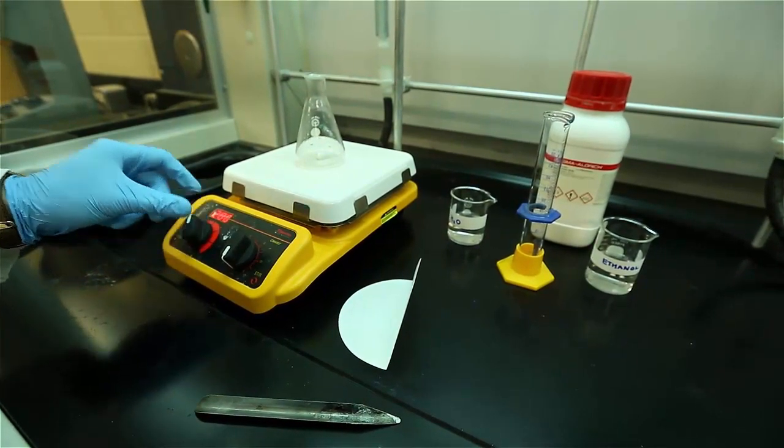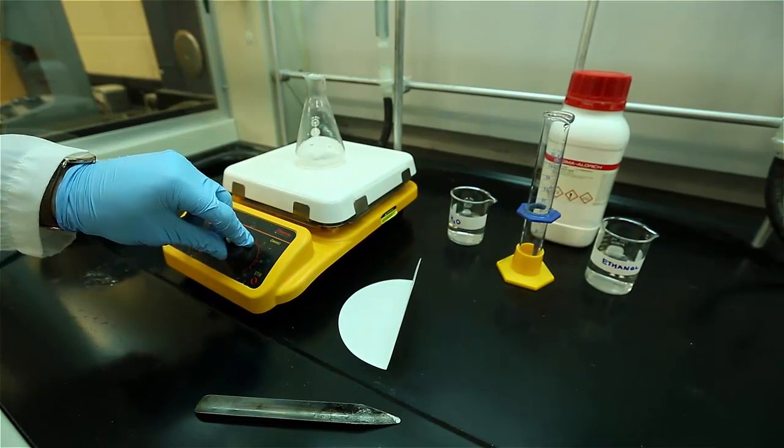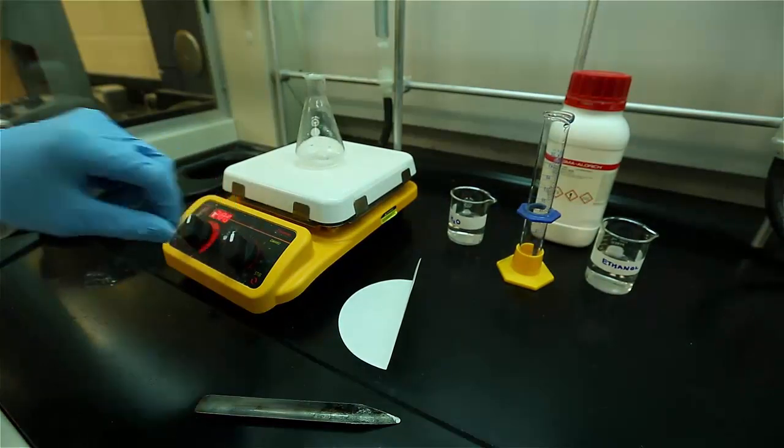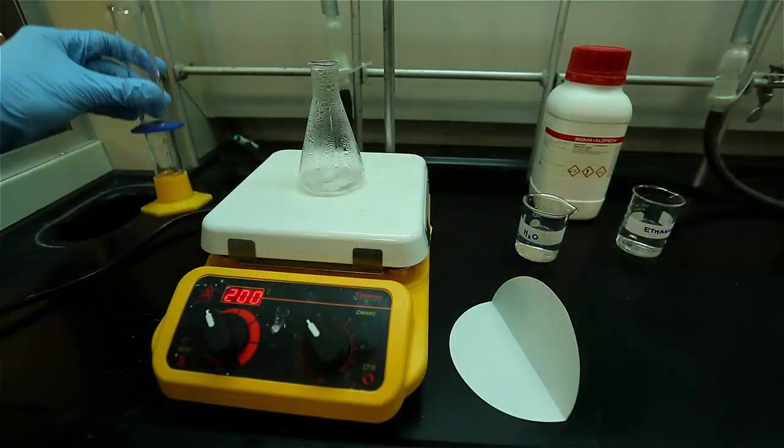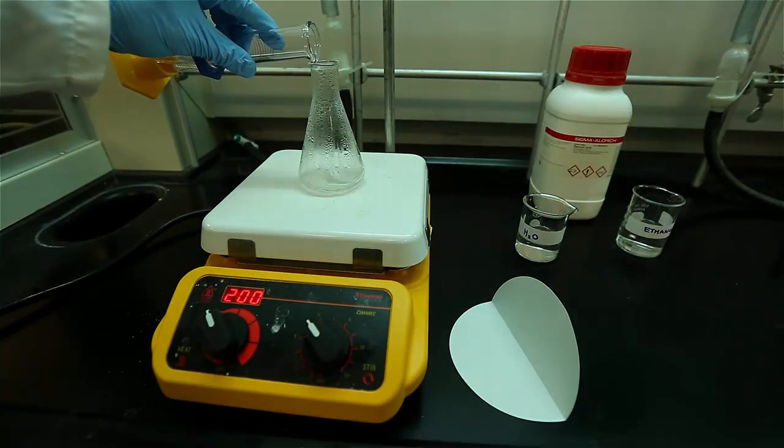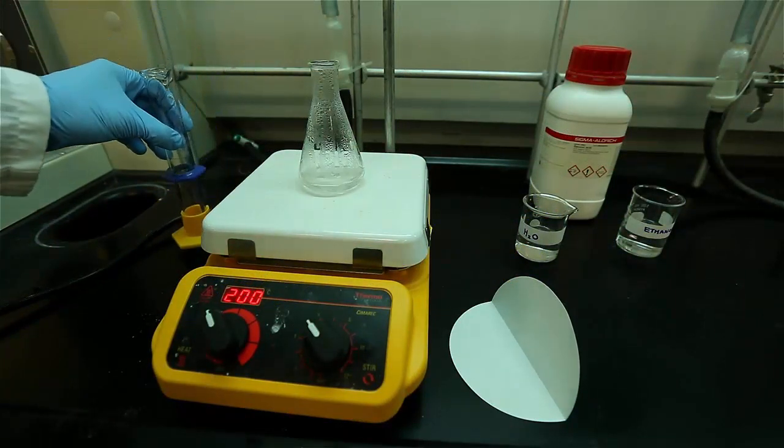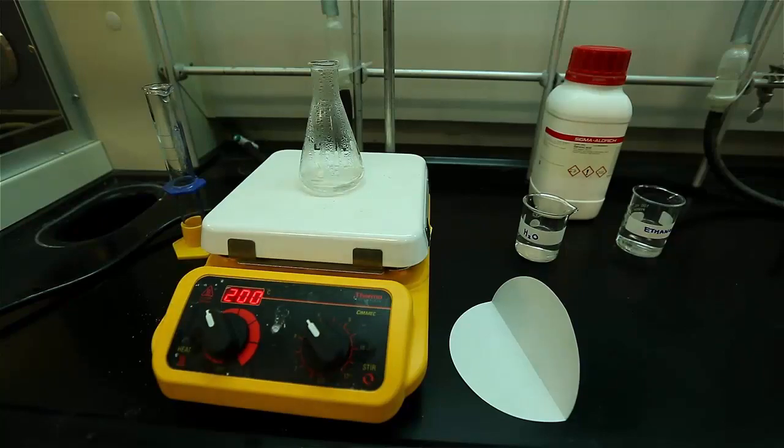Heat the mixture to a gentle boil and wait for the solid to dissolve. If it doesn't dissolve after several minutes of boiling, add a bit more solvent. Obviously, the longer you wait, the more solvent that boils off and less likely the solid will dissolve.